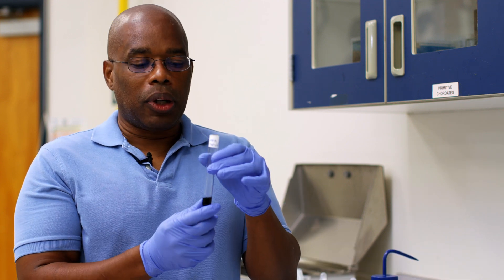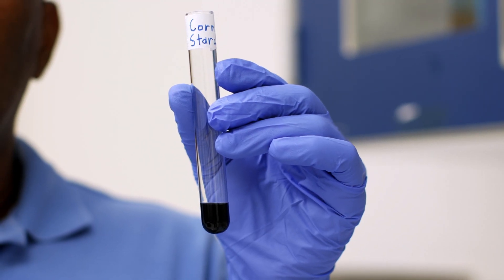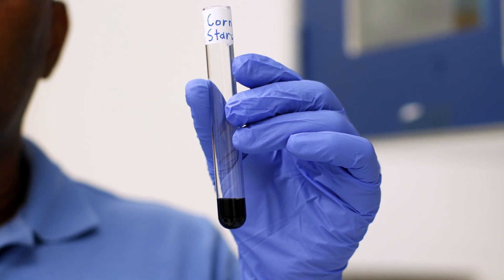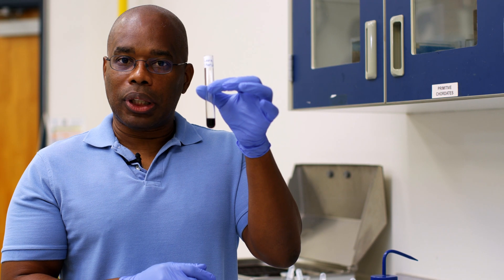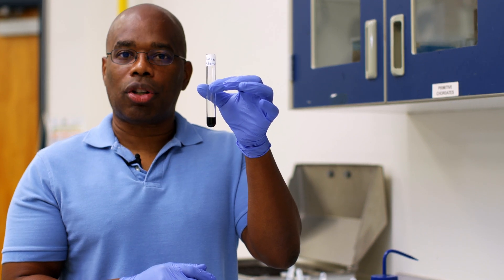So let's analyze our results. The first solution we looked at was cornstarch, and as you can see, we got a very dark color once the Lugol's was added. This is a positive control, and this contains starch.